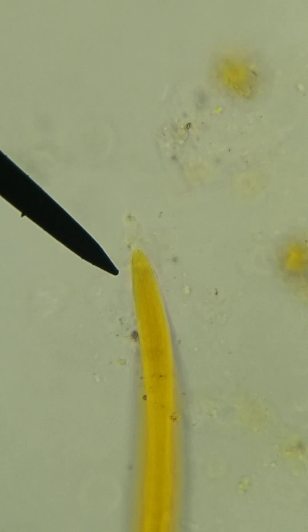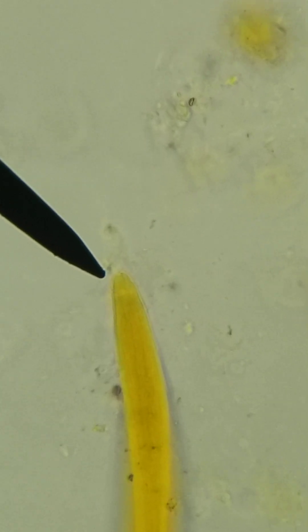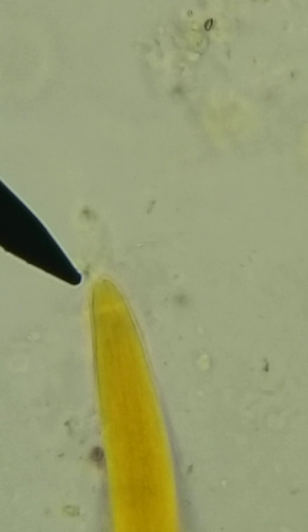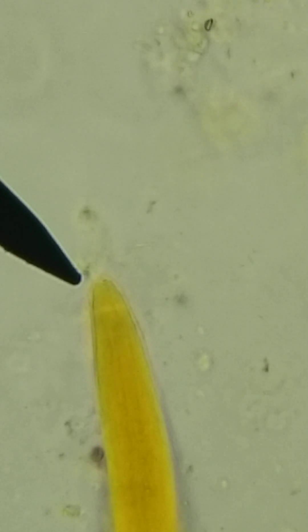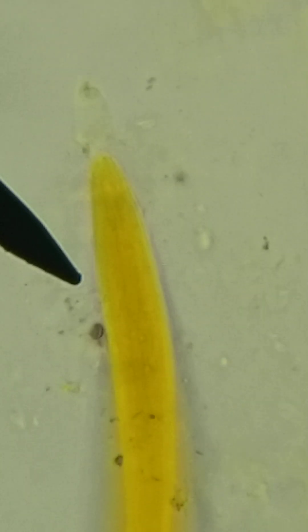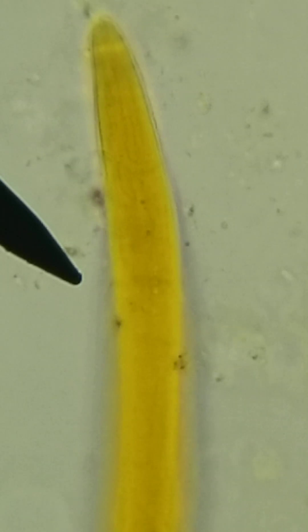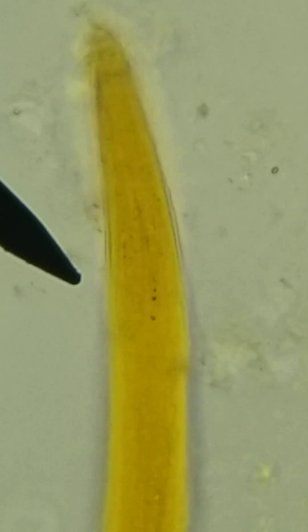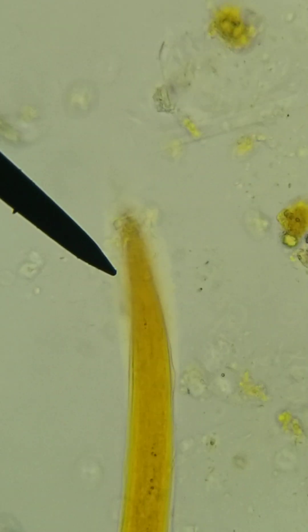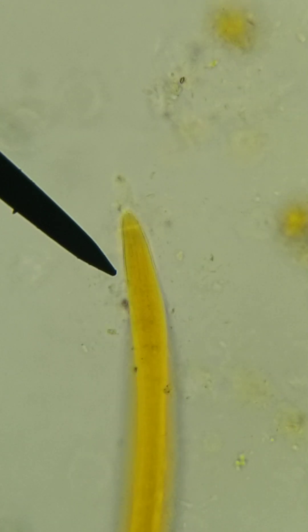Here we've got the little tiny mouth — you can almost hardly even see it. So cute. You see the little indent going down into the esophagus right there, which then turns into the intestine. Now let's zoom out and put on the hookworm slide.